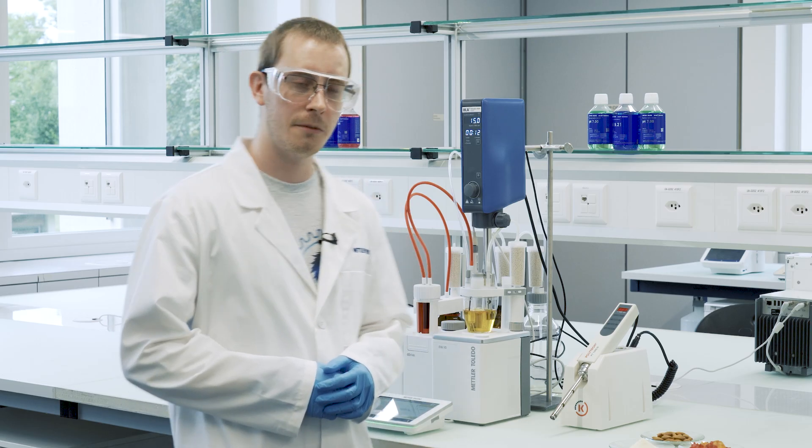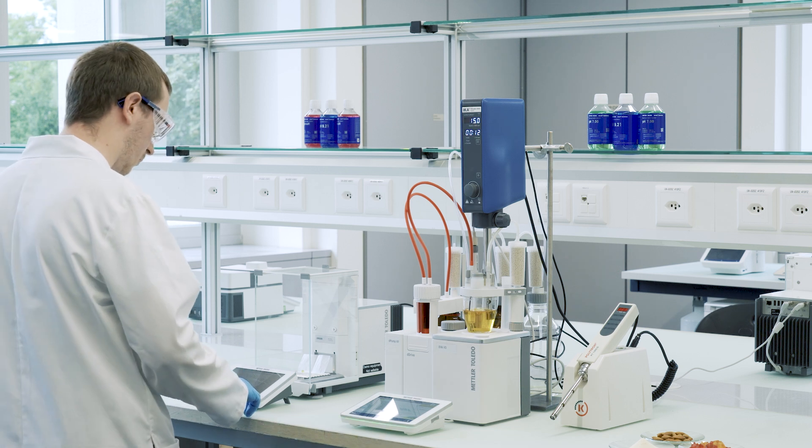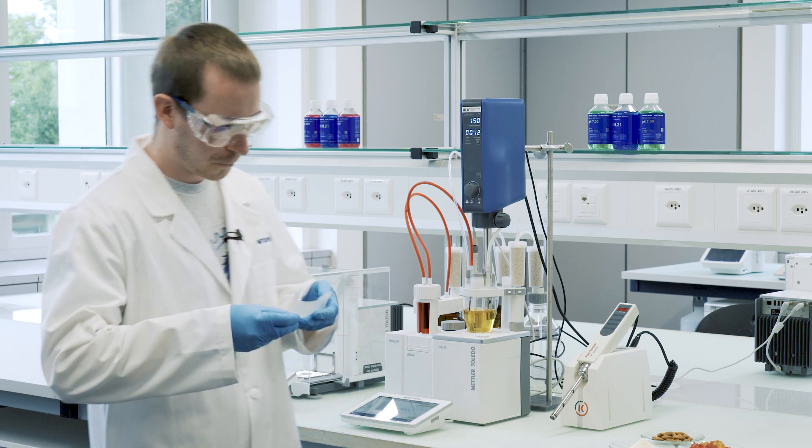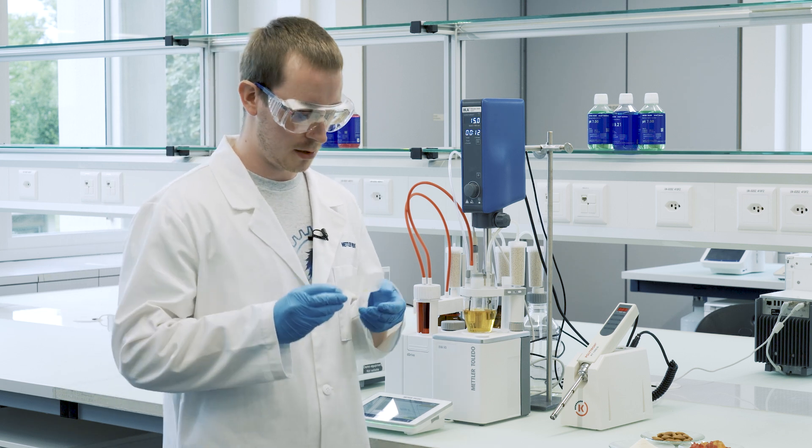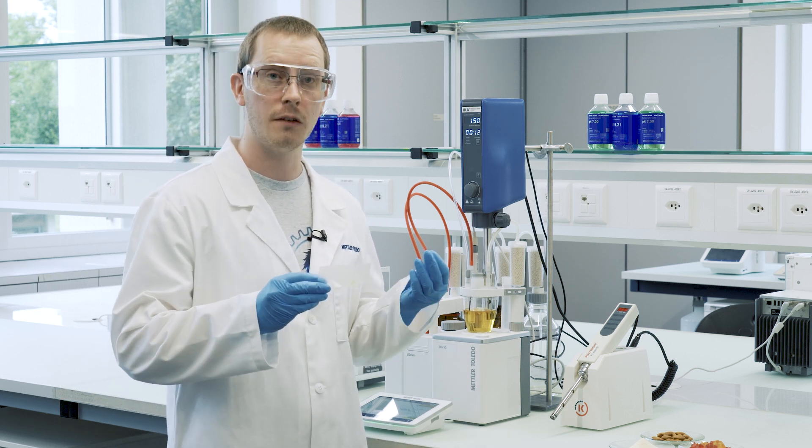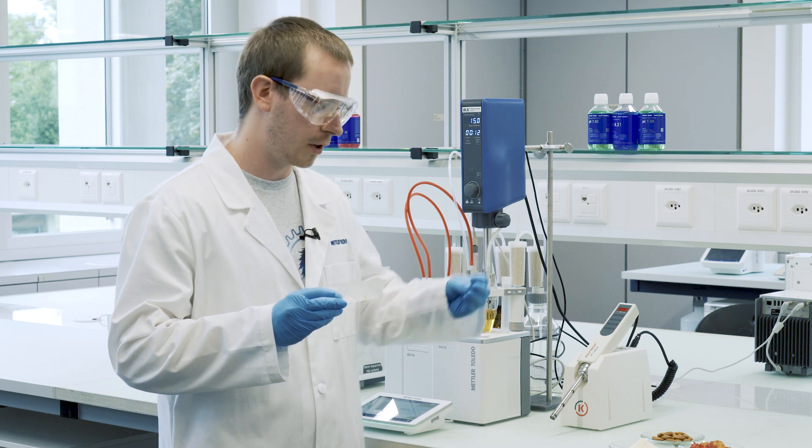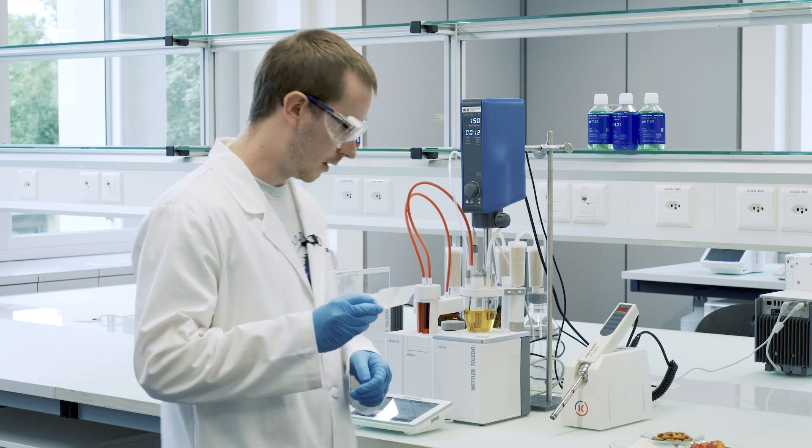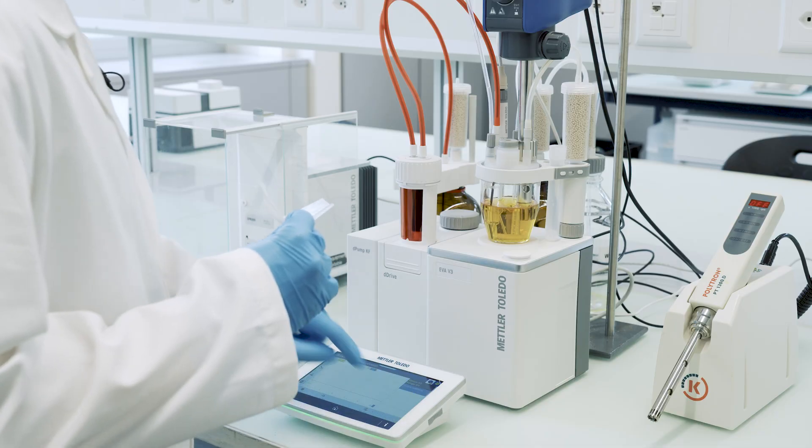Let's start the sample analysis. I've already cut off a small piece and tare it out on the balance. We don't need the full candy and the pieces need to be small enough to get pulled into the homogenizer so that they get shredded efficiently, and so we start the sample.